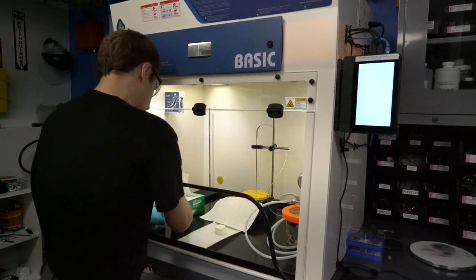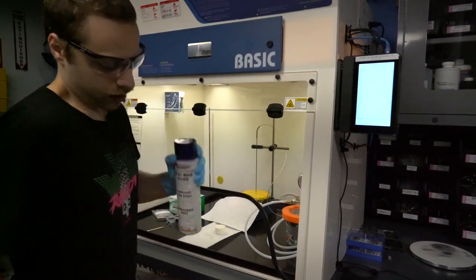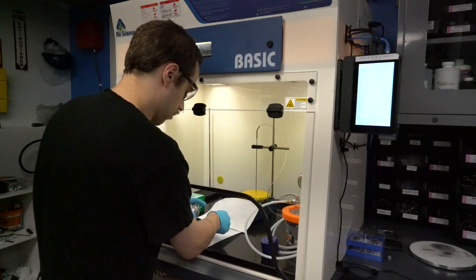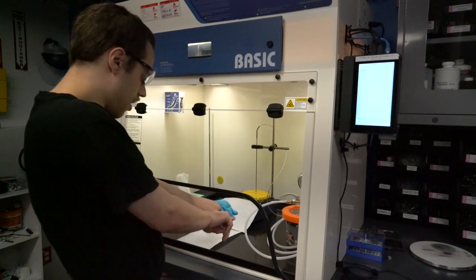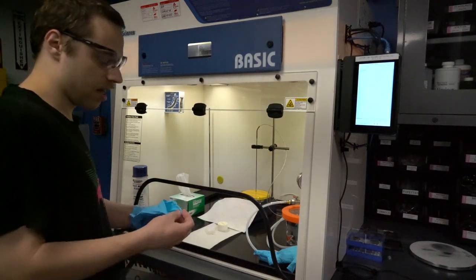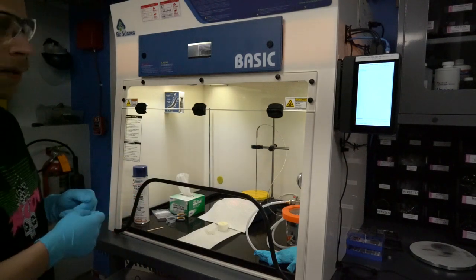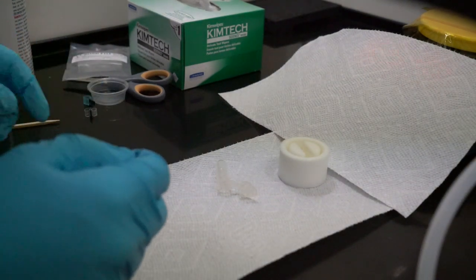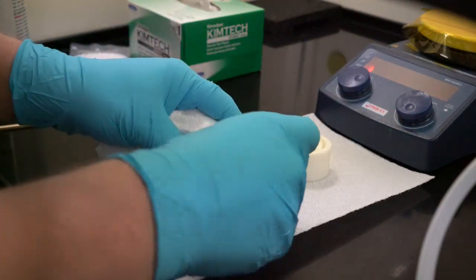The first step is to prepare the molds so that the samples don't stick to them. I'm going to be spreading them down with some mold release. I'll take off these gloves and get a new pair, and leave the old gloves in the hood because the mold release has some volatile solvents in it — I'll just let that evaporate before putting it in the trash. Now let me move the camera so you can see a little bit better. We've got the two molds prepared. I'm just going to wipe a little bit of the extra mold release off the exterior so they're easier to handle.